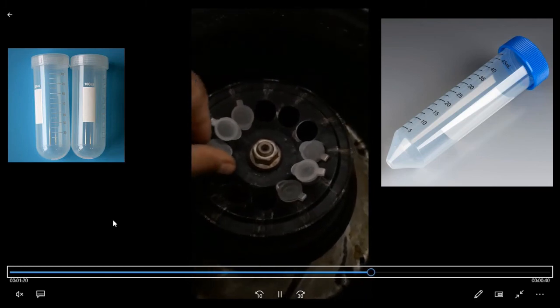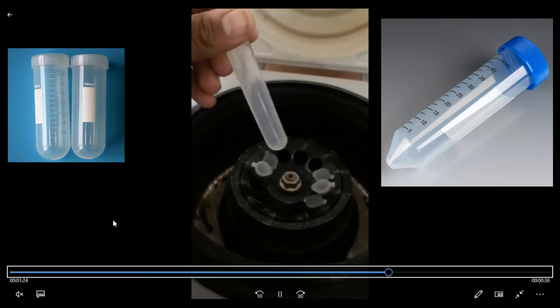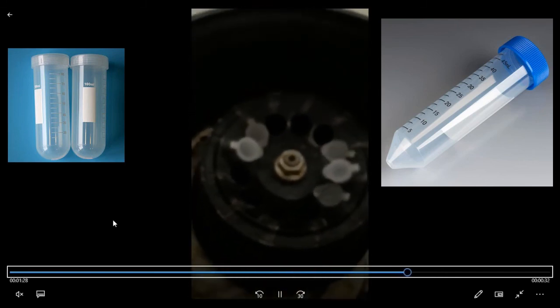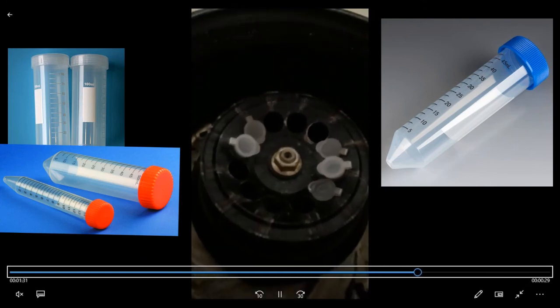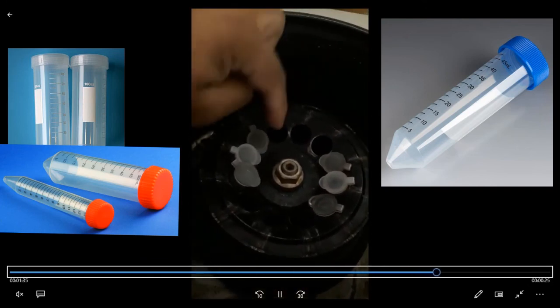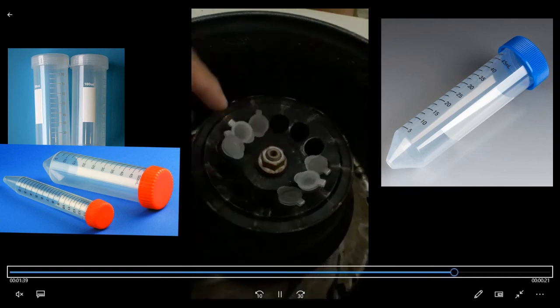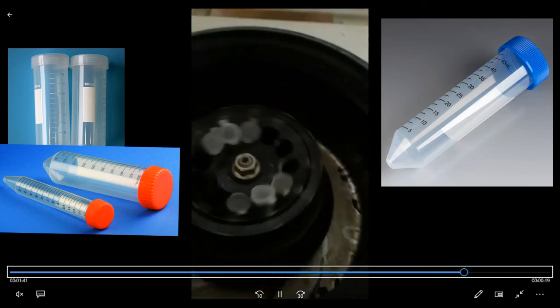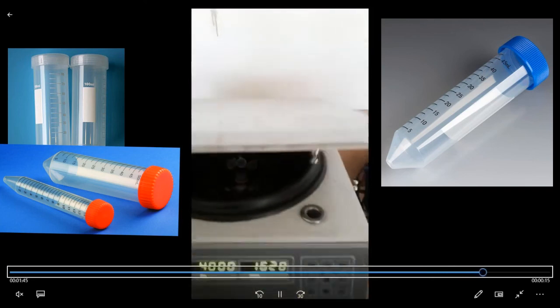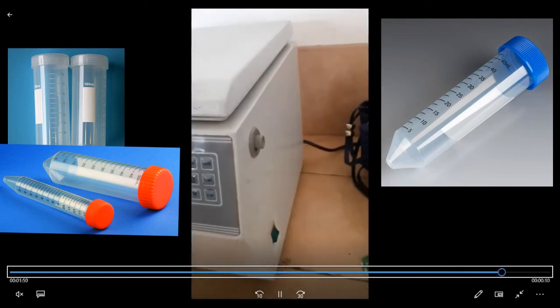Now have a short look at the centrifuge tubes. These are centrifuge tubes specifically made for this type of centrifuge machine. There are several other types. You can look at their screen. These are for other types of centrifuge devices. Just place these tubes symmetrically. I have counted that these are placed symmetrically. Both pairs have three holes or gaps of the centrifuge between them.